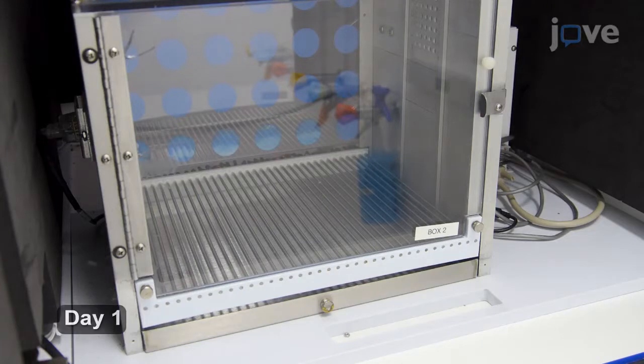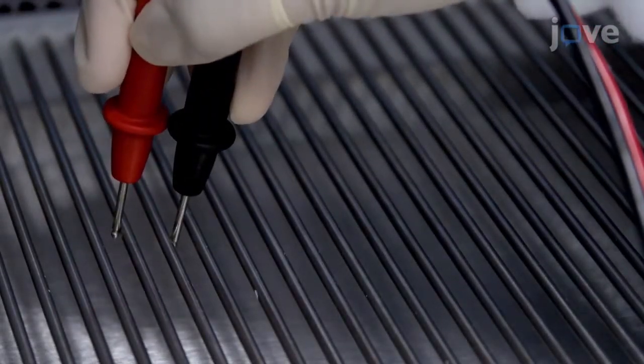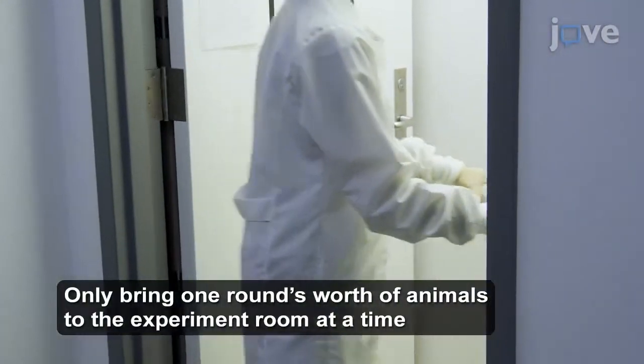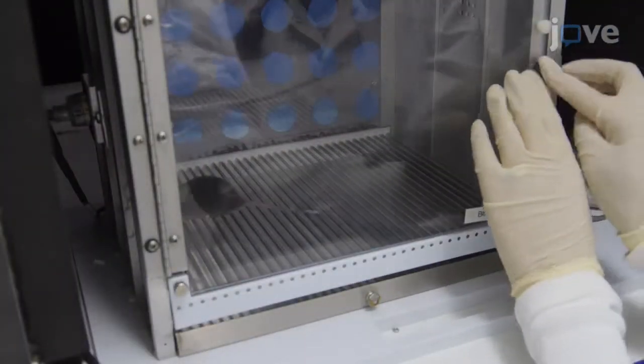On day 1, set up context A with grid floors and visible light. Ensure the multimeter is attached to different bars to confirm the desired shock amplitude. Transport animals from the vivarium to the experimental room in their home cages placed on a cart, and place individually into the 4 fear conditioning chambers.